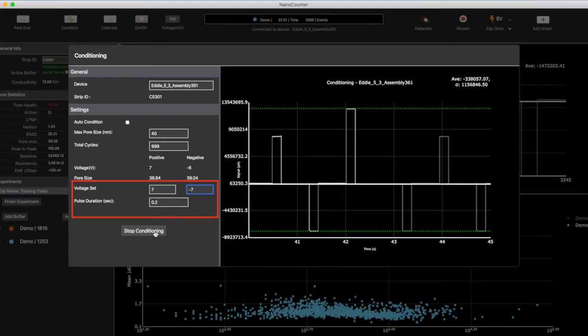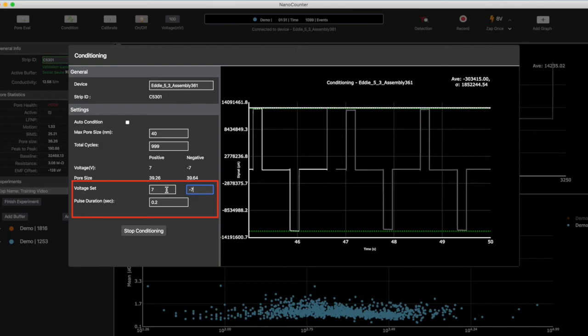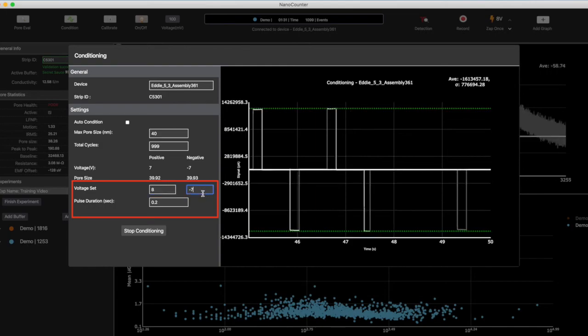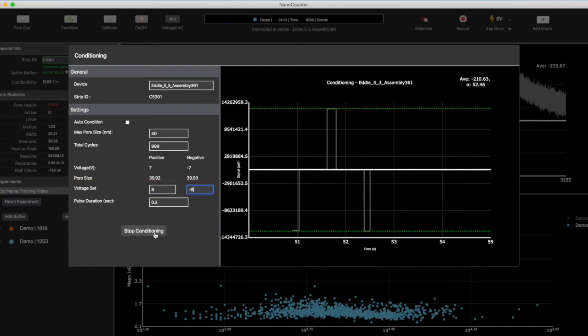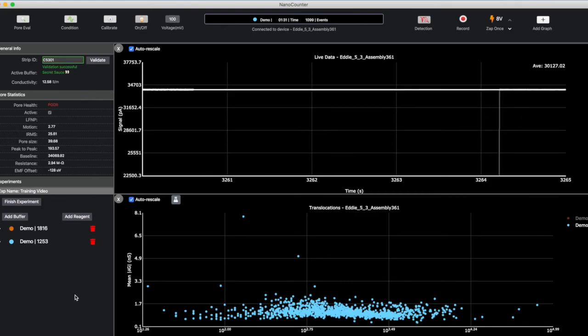By now, most pores will have responded with 6 or 7 volts. Occasionally, a pore may need 8 volts, but be cautious. At these higher voltages, rapid pore degradation is more likely, so give the pore just a few pulses of voltage and then stop conditioning quickly. This method is effective, but tricky, so be diligent and use caution.